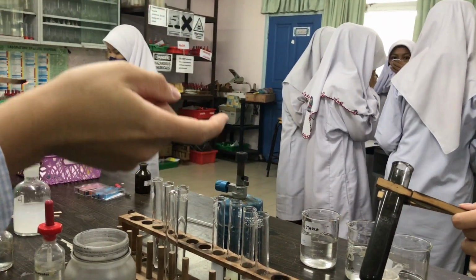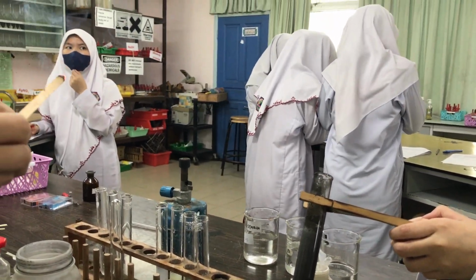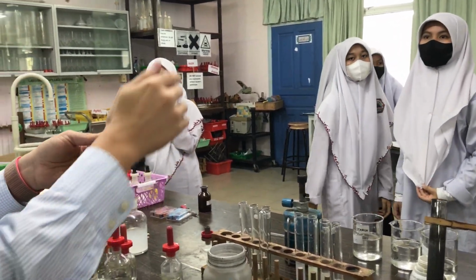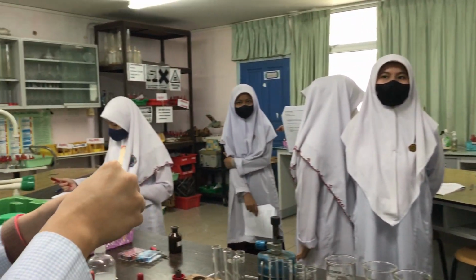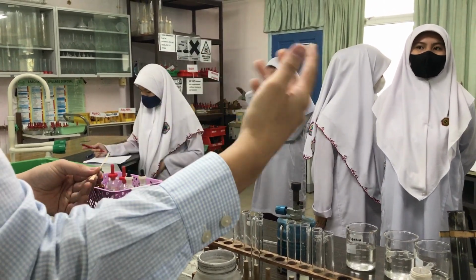What was the gas present, Daniel? What was the gas that she tested for? Okay, never mind. Okay, let me ask. Shazwani, what is the gas that she tested for? Oxygen gas. Okay, thank you for listening. Okay, so oxygen gas using glowing splints.